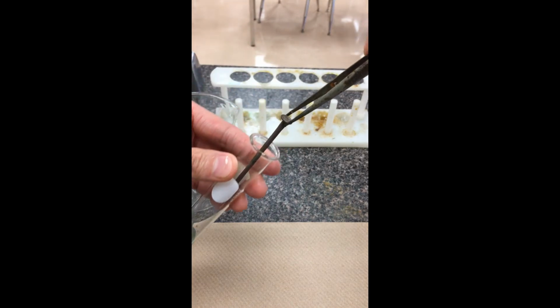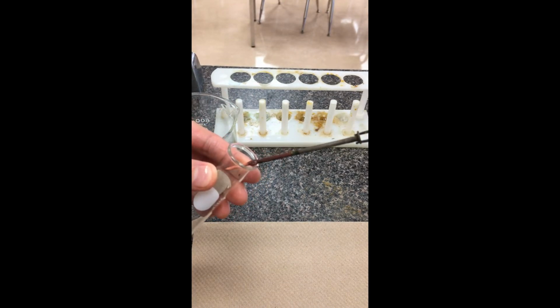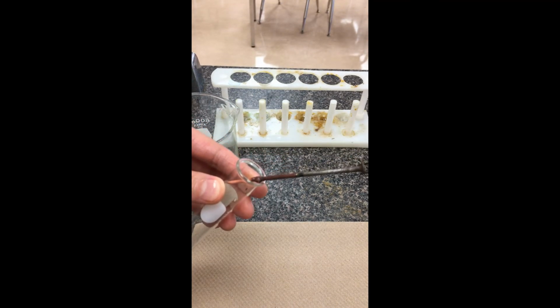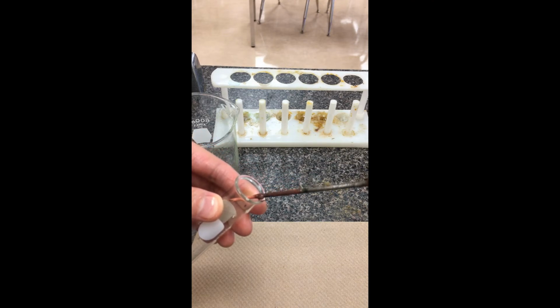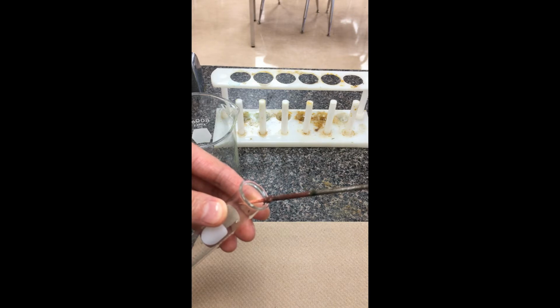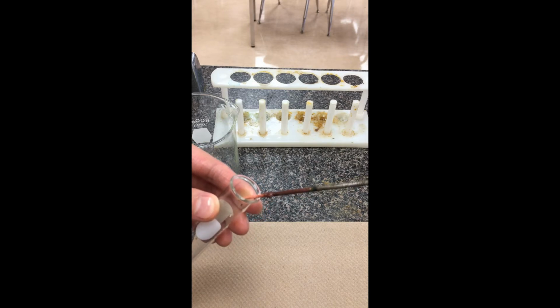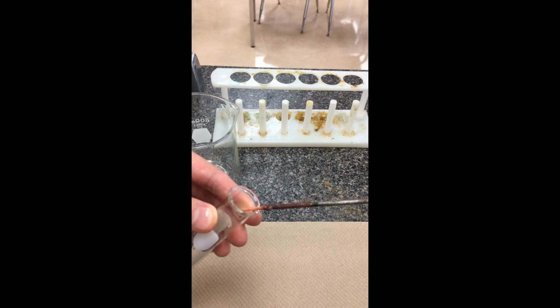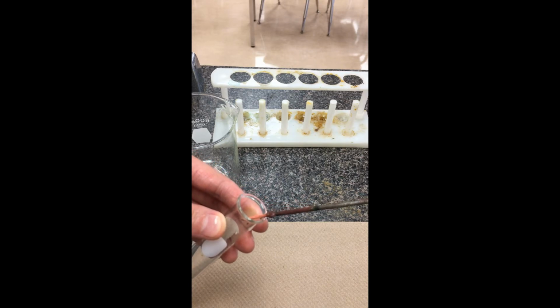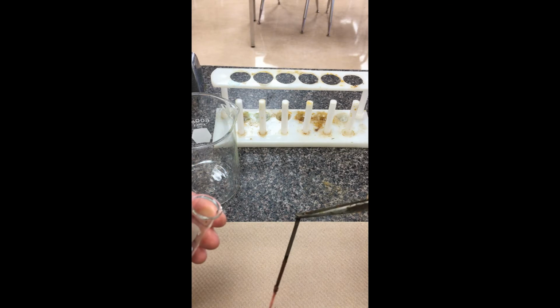So with this nail here, you notice it's quite significantly different from what we had before. We've lost the grayish silvery metallic surface, and it's now been coated with a more reddish looking material. Towards the bottom of the nail, it actually gets a little thinner. That's where the red material built up quite a lot. I'm just going to leave this nail down.